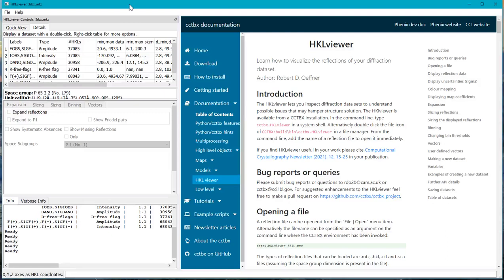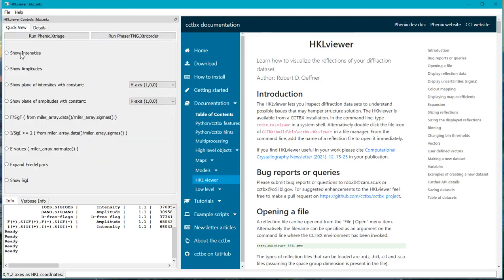Here we will demonstrate how to use the HKLviewer to inspect problematic data such as the data file 3rbx.mtz, which we have already loaded. Datasets available are listed here in the Details tab. And if we have Phenix installed, then on the Quick View tab we have these two buttons, Xtriage and Xtricorder. So now let's try and run Xtricorder to analyze the datasets in more detail.